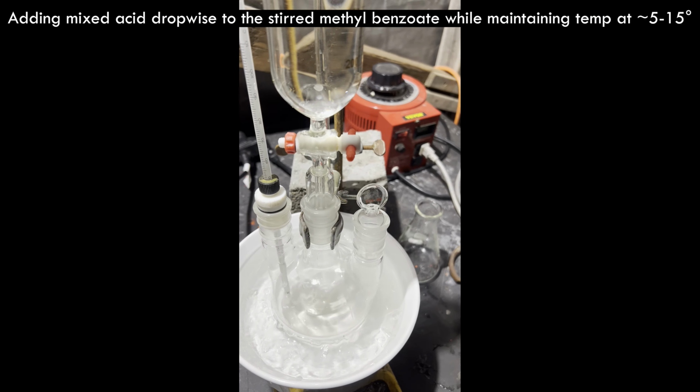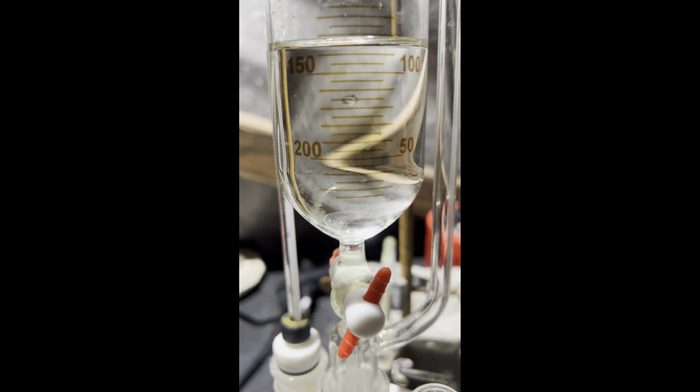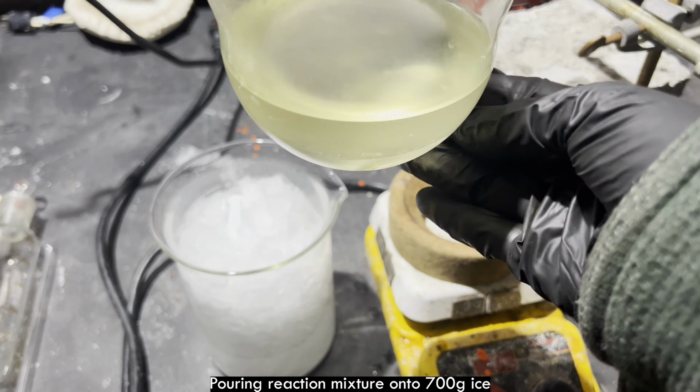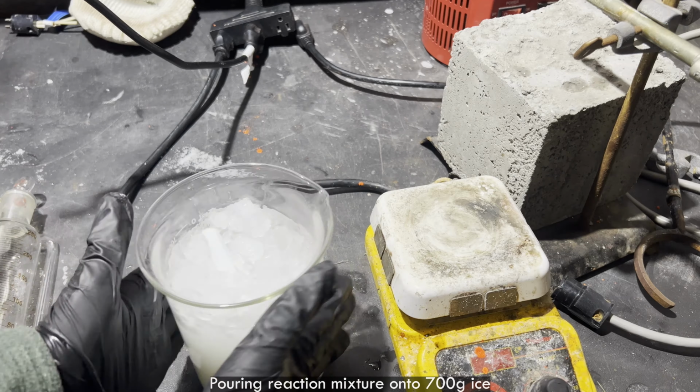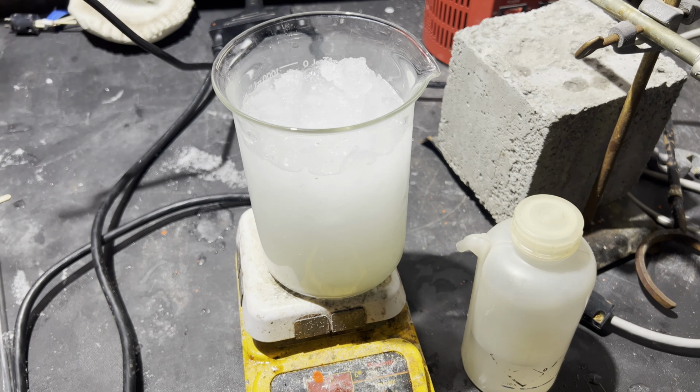I don't do nitrations often, so I was very confused as to why it went so badly. The procedure I used was from Vogel's Textbook of Practical Organic Chemistry. Both the 3rd and 5th editions of the book have the same missing reagent in this procedure.